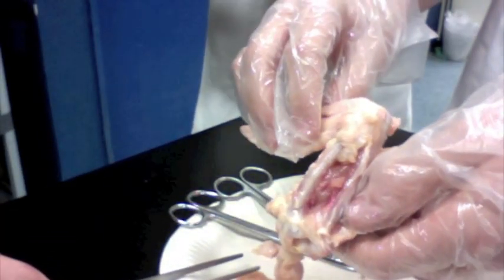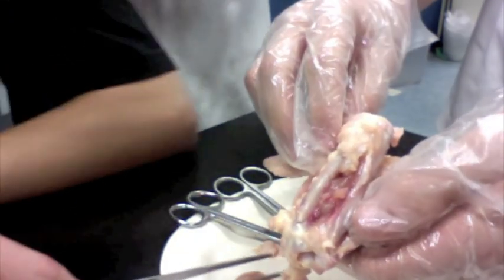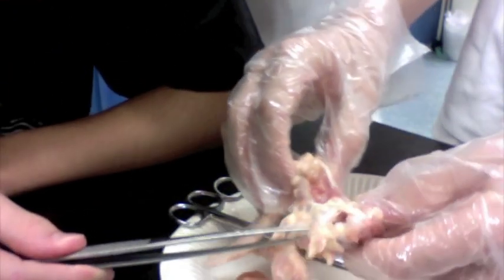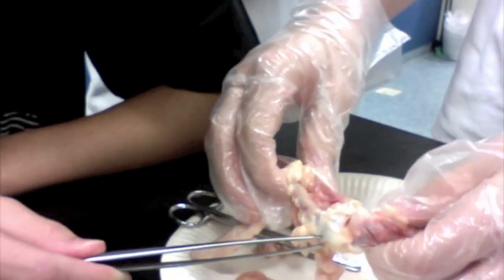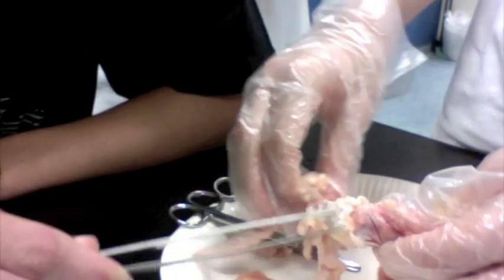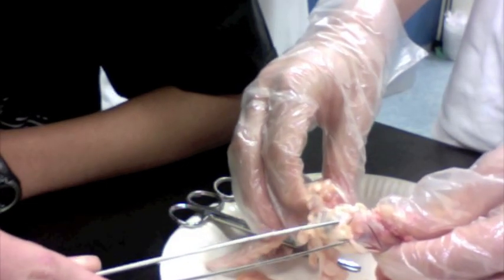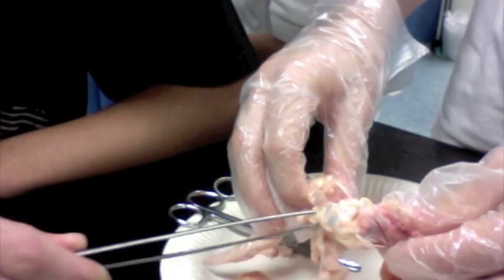Now we're going to look at the joint, which we have right here. That's the joint — yeah, a really clear joint. Basically, it's just a beautiful joint.